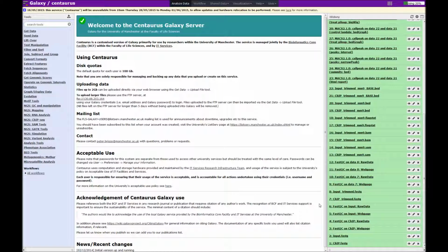Okay, so let's go ahead and run Trimmomatic. So we start off with our fastq files, which we have checked are OK by running fastQC, and I think it's important to mention that even though we didn't detect any particular problems with those sequences, I always run Trimmomatic just to make sure that the files are checked for any contamination with adapters and to check for the quality of the reads.